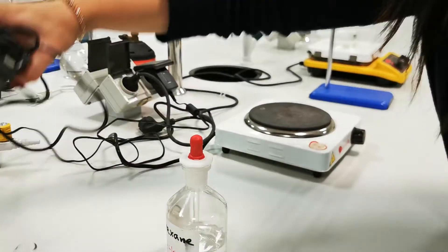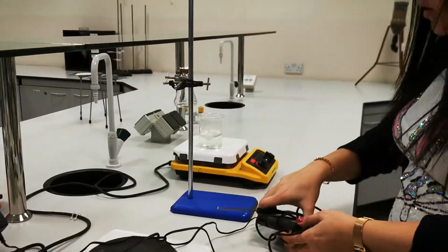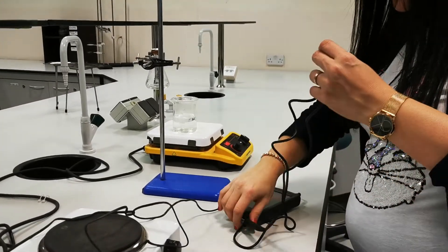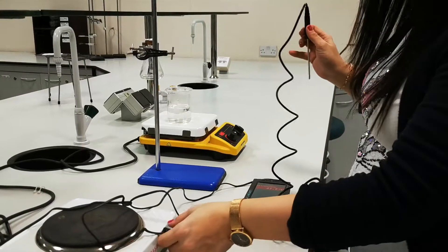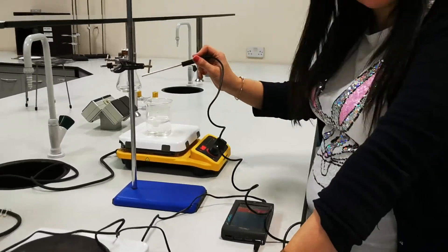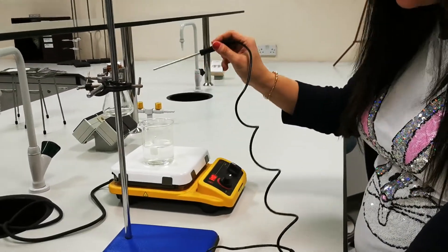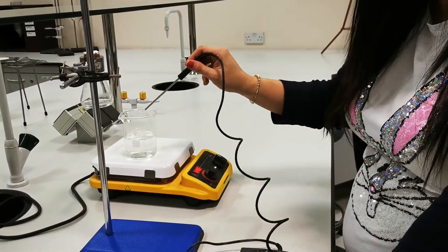Meanwhile, I can check the temperature of the boiling water using the temperature sensor. Note that I will only insert the volatile liquid in water when water is boiling.